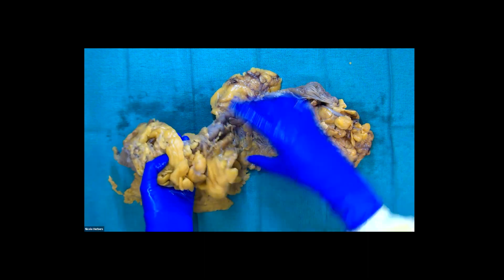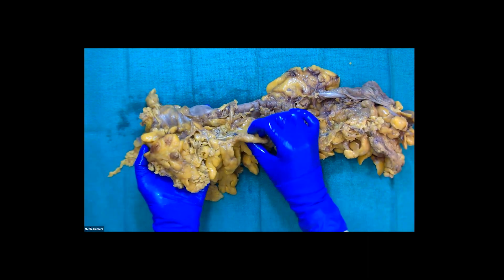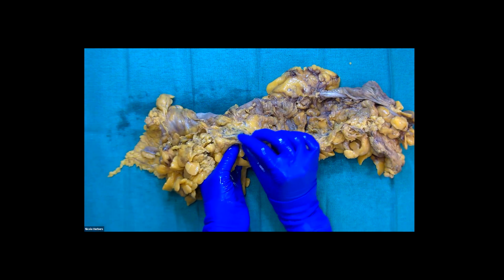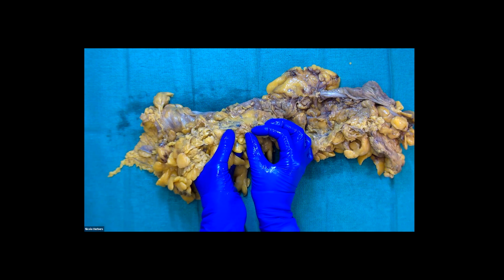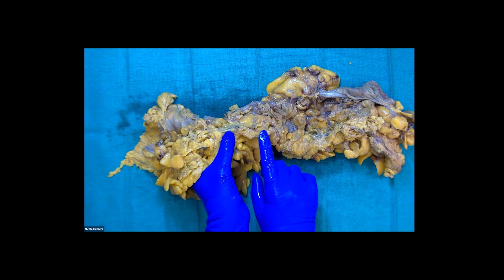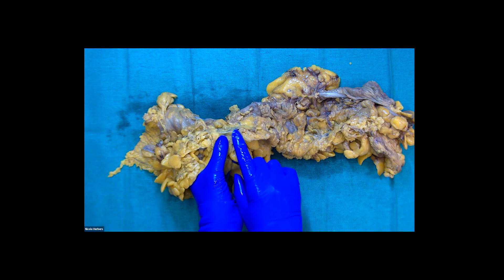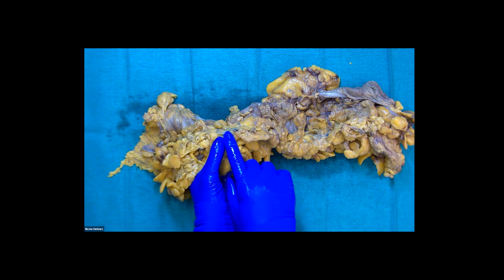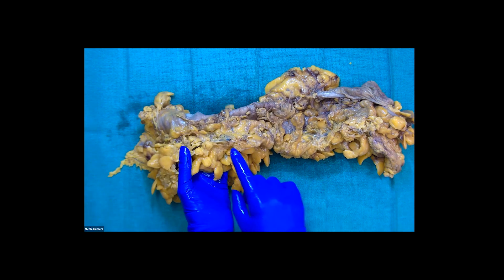When I get more into my transverse colon, we can actually see the vascular tie margins — this vessel here and this rough area along here — that would be my vascular tie margin if I had a cancer closer to my transverse colon.